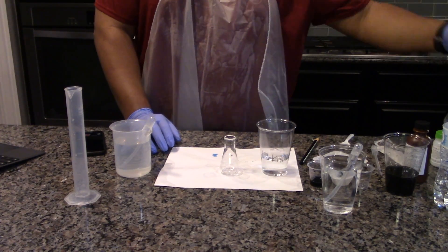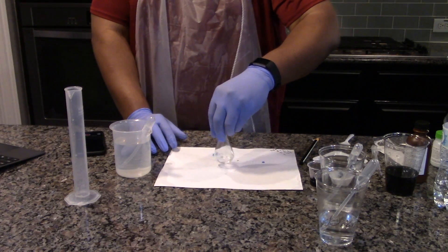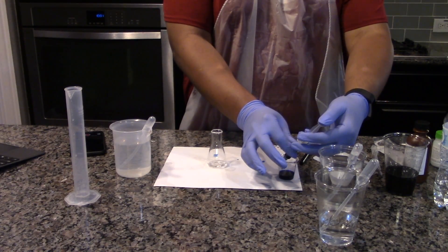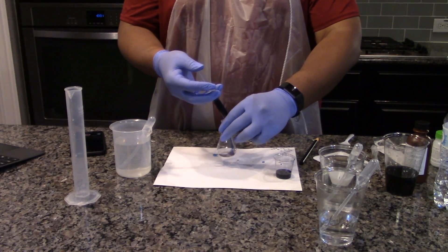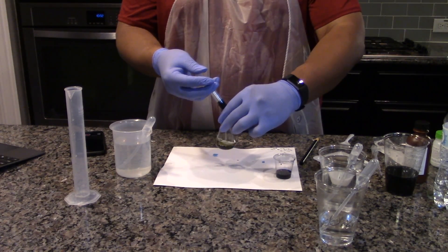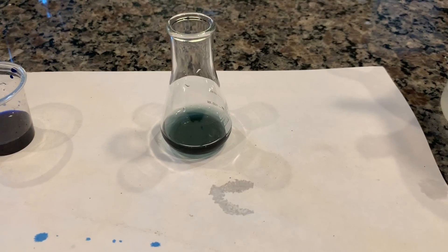Titrating the unknown concentration. Transfer 2 mL of the unknown sample to the 25 mL Erlenmeyer flask. Refill the syringe with DCPIP to the 5.0 mL mark. Transfer DCPIP to the flask dropwise from the syringe until the solution in the flask has a distinct blue-green hue. Gently swirl the flask as needed to achieve a uniform color. Record the final volume of the solution in the syringe.